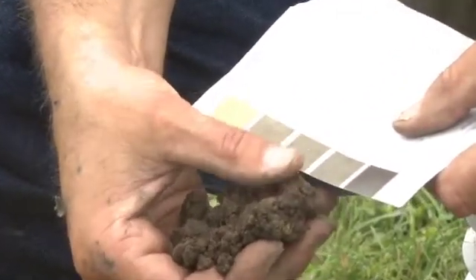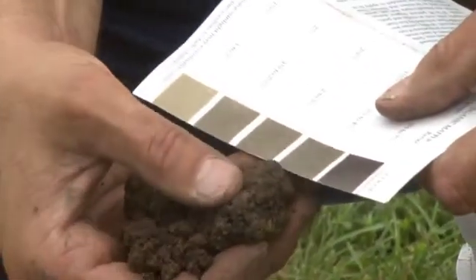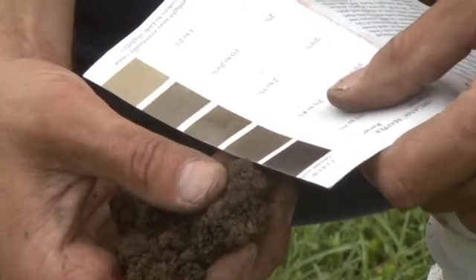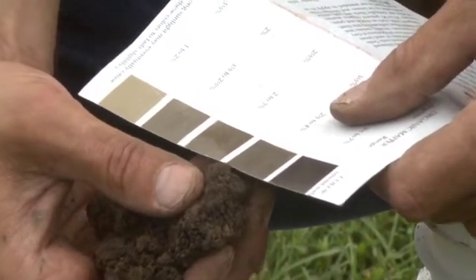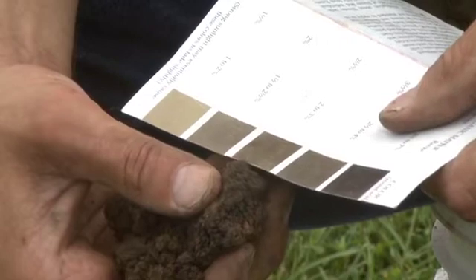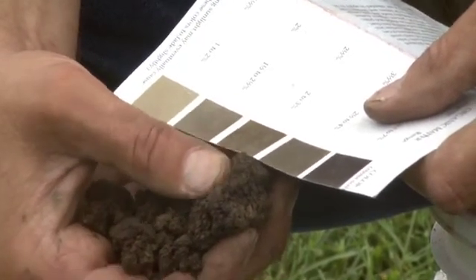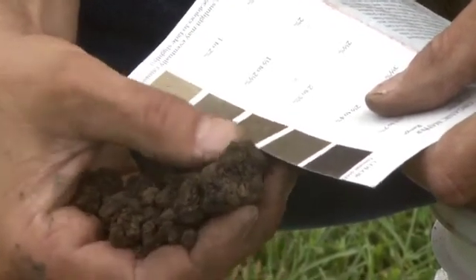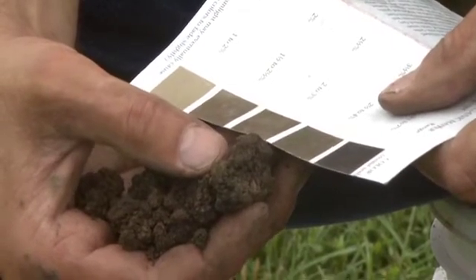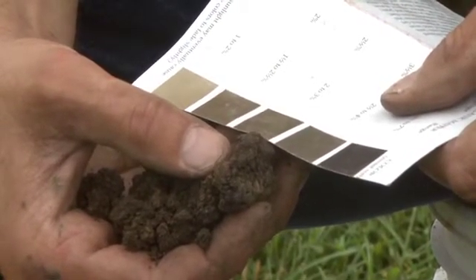What we're doing is comparing this color to the chart that we have here, trying to get the closest match. In this case, the best match that I have is about two to three percent organic matter.